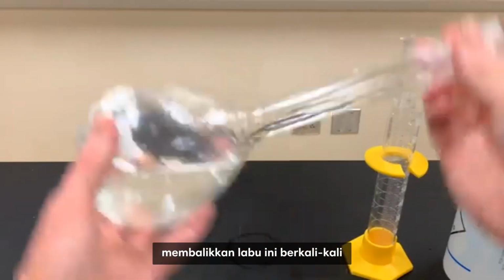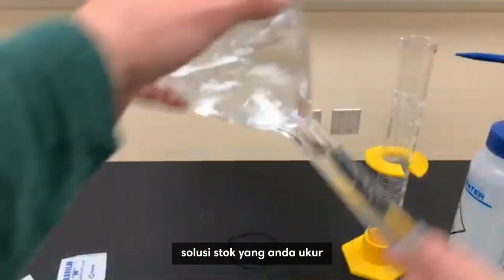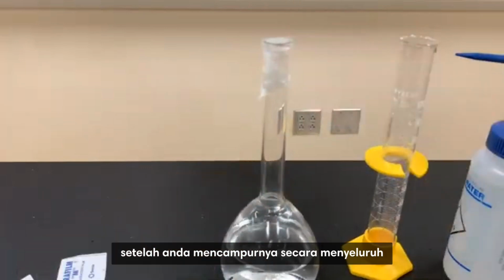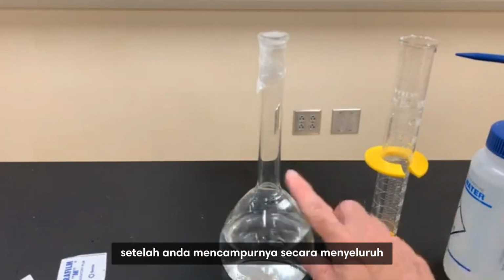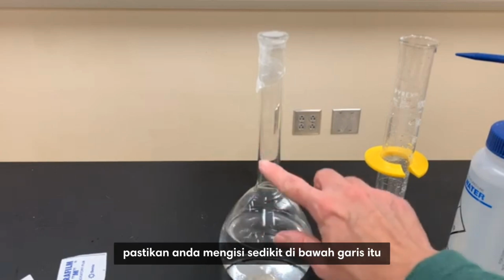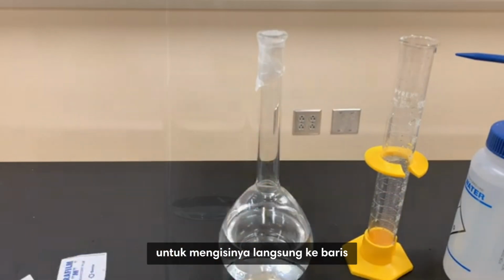Invert this flask numerous times to get a good mix of your stock solution that you measured and your distilled water. Once you have mixed that thoroughly, add distilled water until you get to the neck of the flask. Avoid the line, make sure you fill a little bit below that line. And then again, we need to get this flask at eye level to fill it directly to the line.